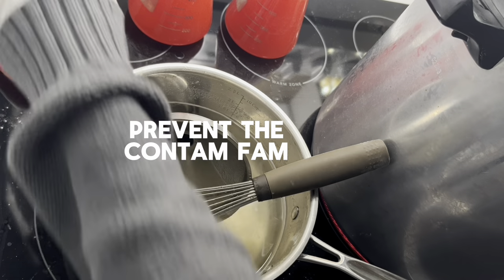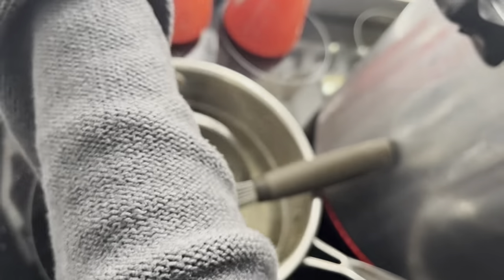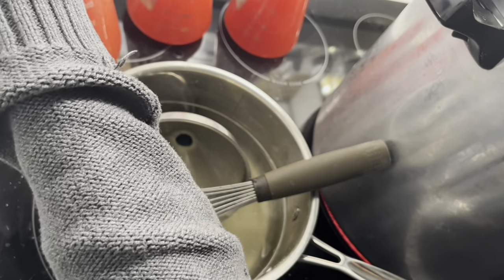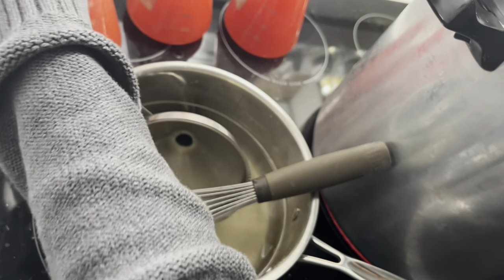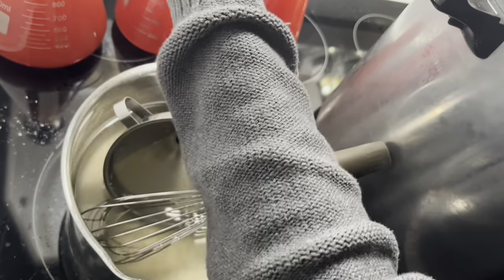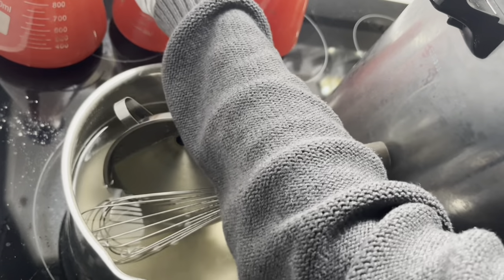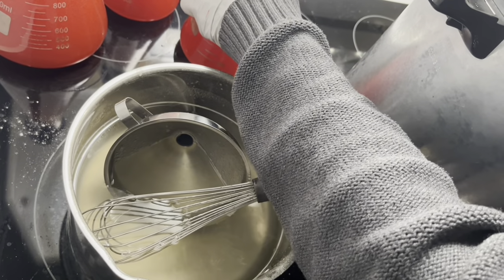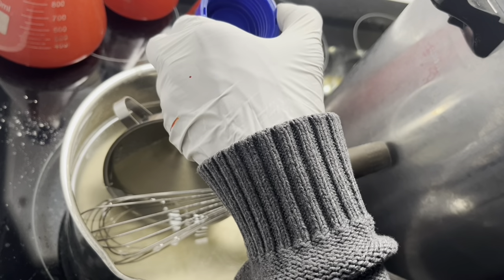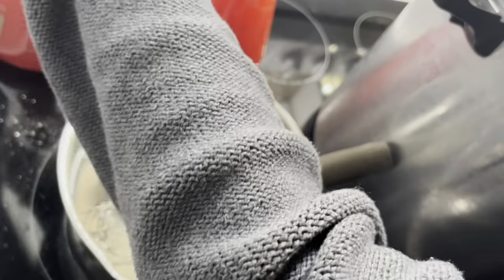I'm going to add more food coloring because these colors are very pale, they're not very rich. Also, the mycelium digests the coloring too, so when you get colored plates and the color is gone, I don't like that. I want it to be colorful and vibrant. So we're going to add some more color — these little flasks are pretty much a single-use size and the color will continue to mix in the pressure cooker.